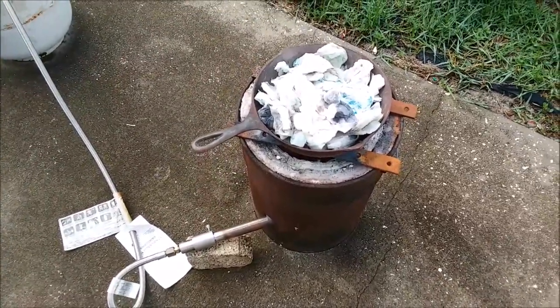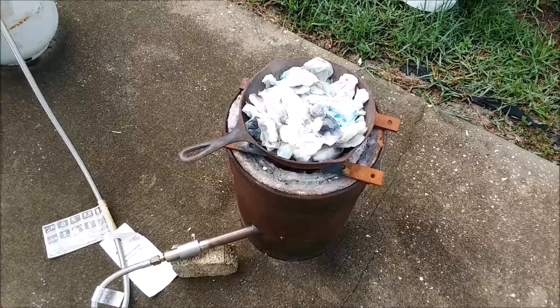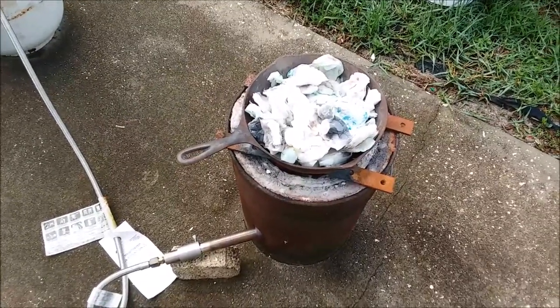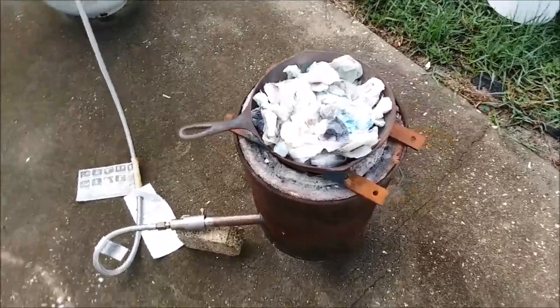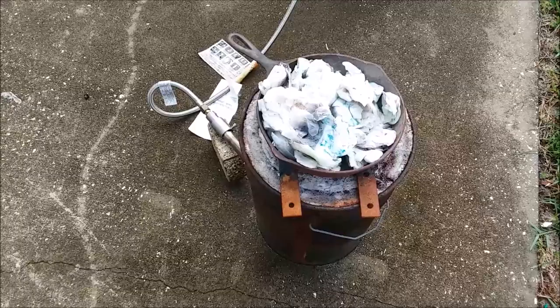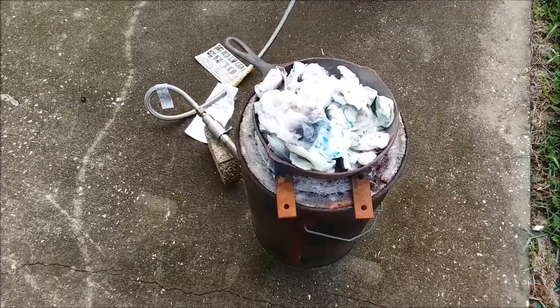It won't all fit in this frying pan, so I've got most of another mason jar to go. I'm going to try and cook this stuff down — it's all soaking wet. I'm going to try drying it out and incinerating it. It's a good morning for it because there's no wind. I don't want the wind blowing the ashes around because the ashes are going to have the gold in them. So it's on the fire, it's starting to heat up. I'll stir it around and dry it out and incinerate it. Once the bulk goes down a little bit, I'll add the rest. Once it's all ashed, I'll process the ashes and we'll see how much gold I get out of it.